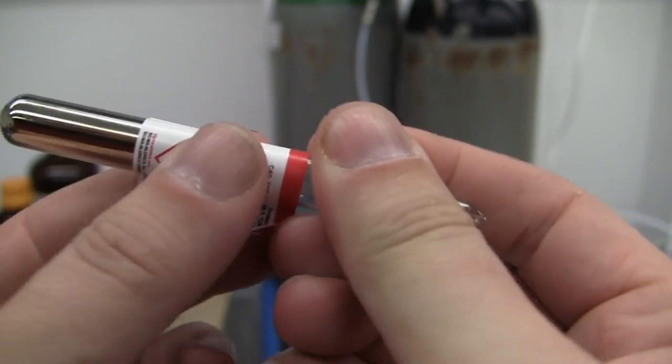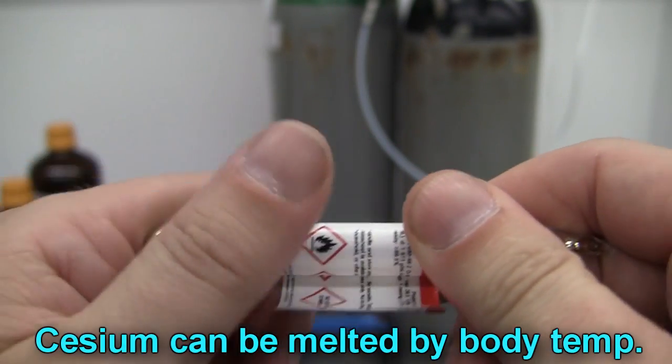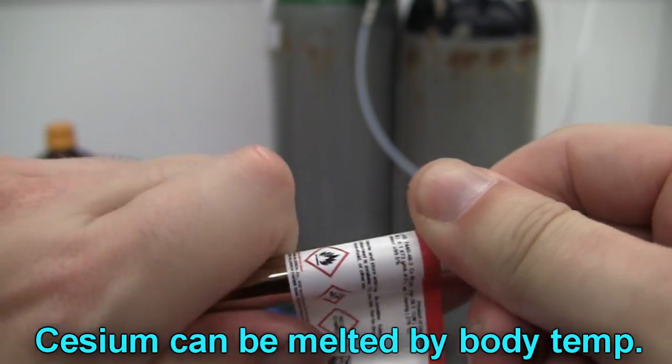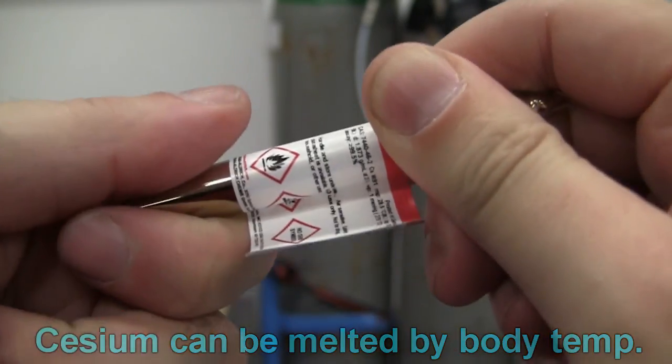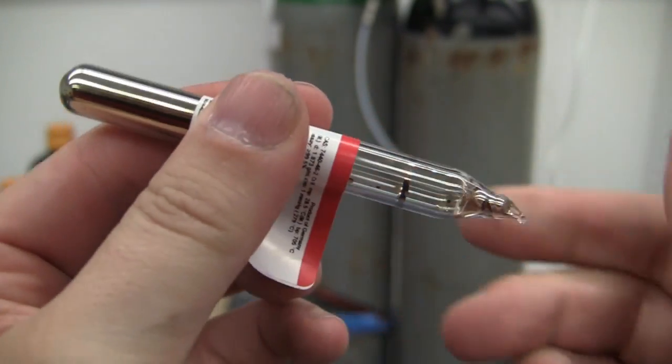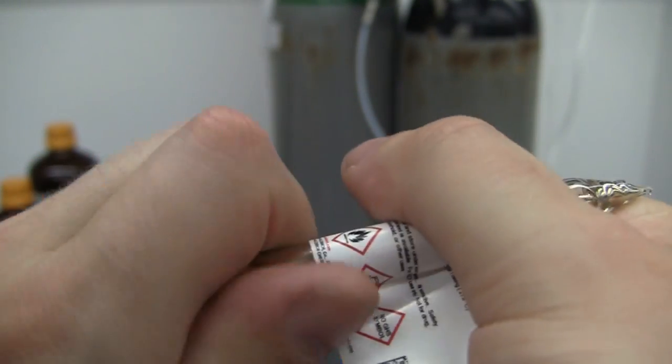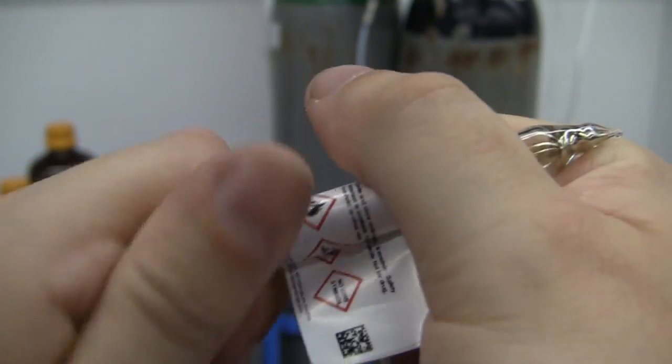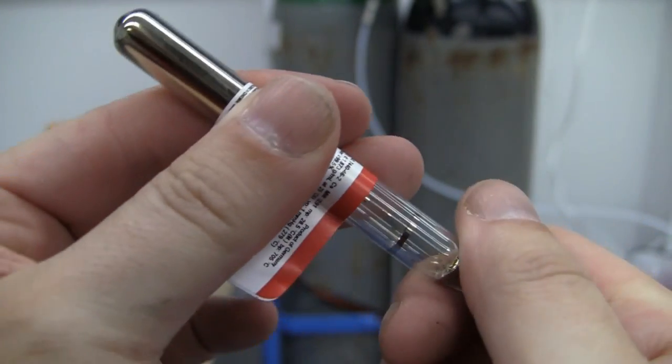So now we have cesium. As you can see, at the moment it's really quite solid. I'm just going to warm it up with my fingers. Now, this stuff has a reputation for being an absolute beast for reactivity, but I think most of it is just bluster. This stuff is nowhere near as reactive as people say.